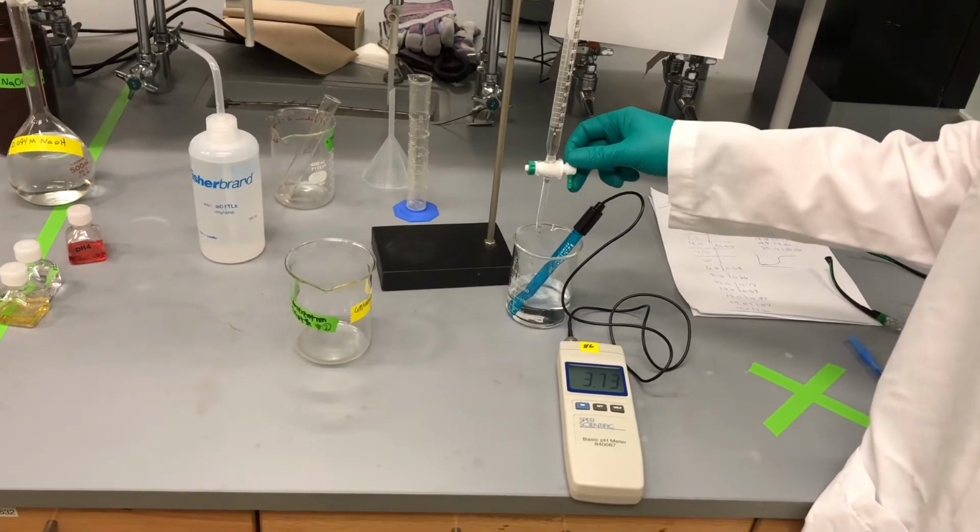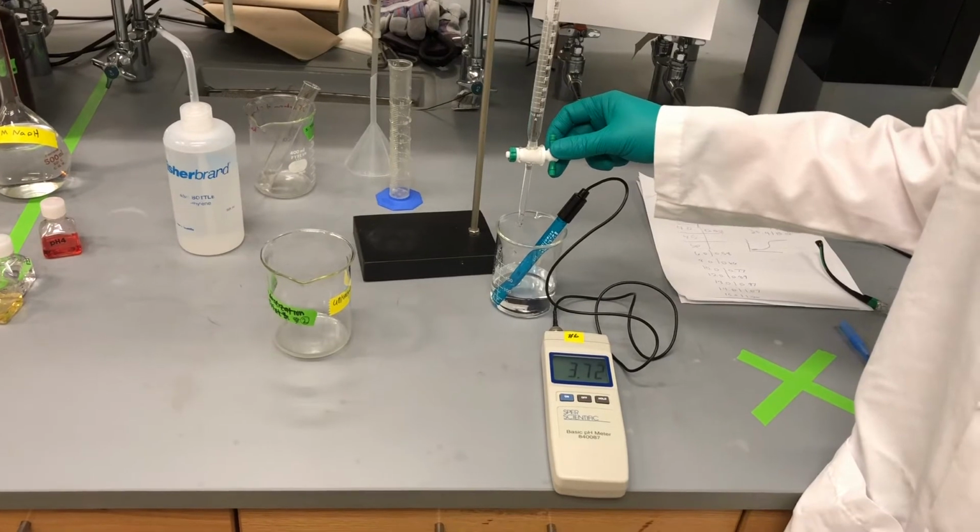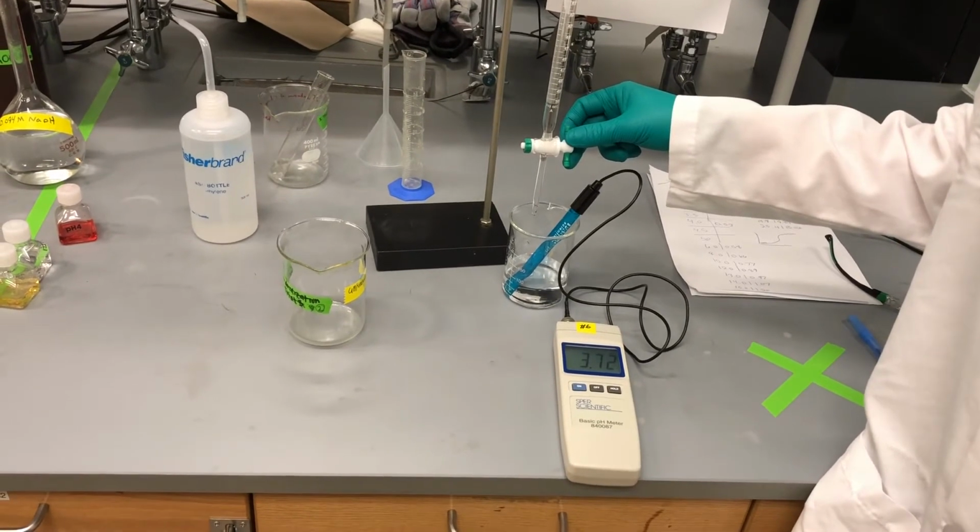Go ahead and add until the 8.5 milliliter marking.